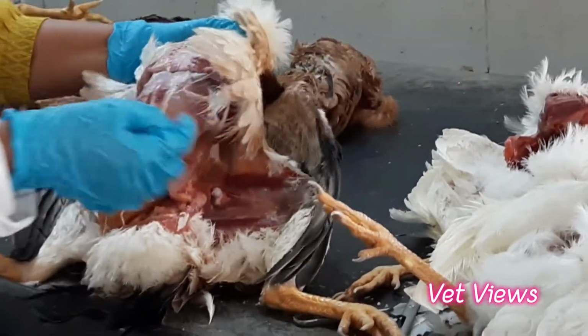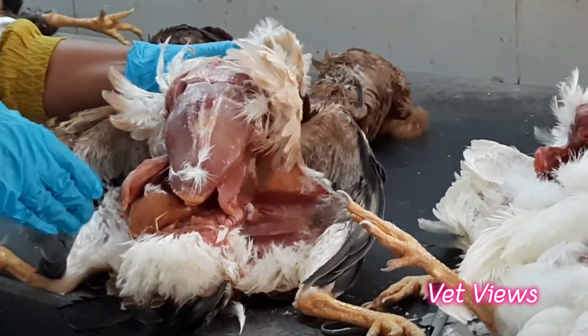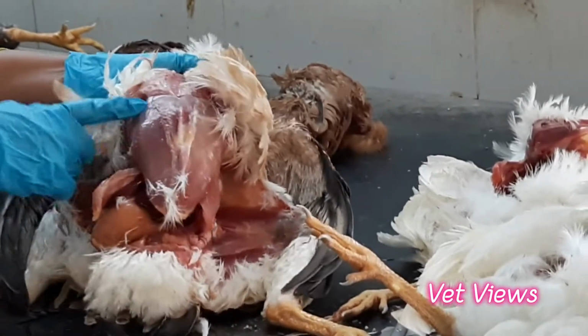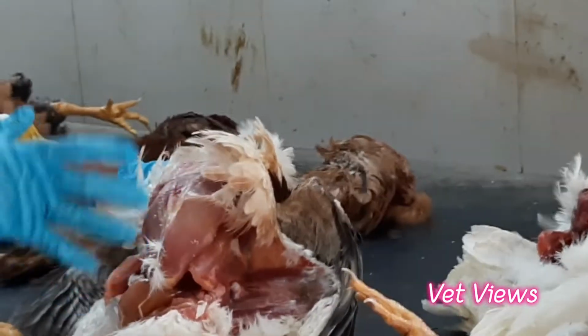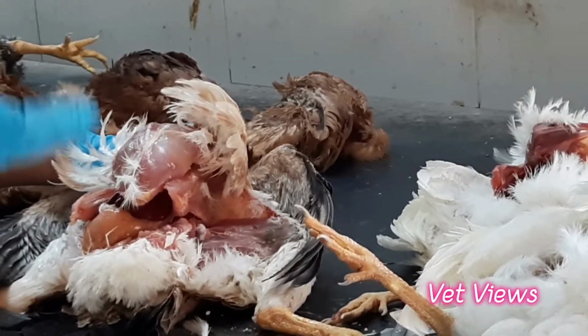In emaciated cases, because the muscle is completely removed, the keel bone will become bent. It will become very prominent as well as disfigured, and this area will be completely empty. You can see the keel bone itself nicely here when debilitation happens. In those cases you have to suspect a chronic disease. It can be mycoplasma or any tumor disease.